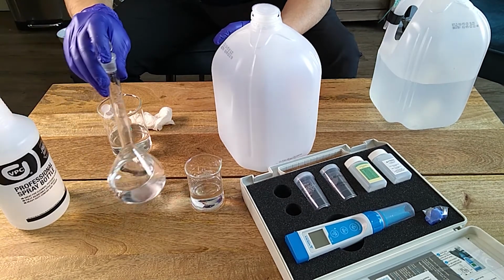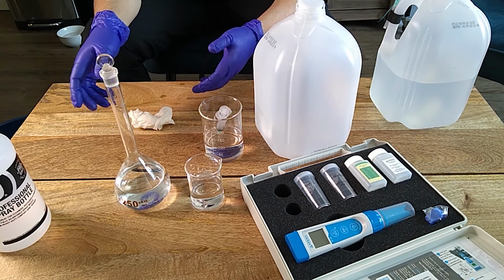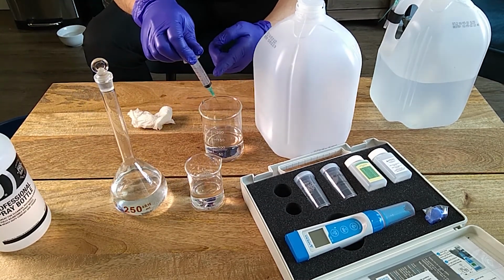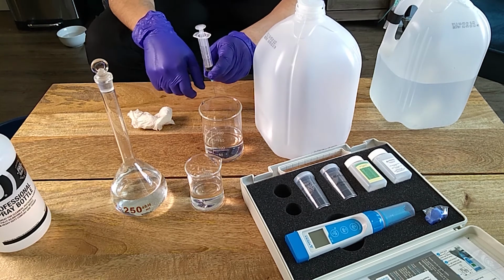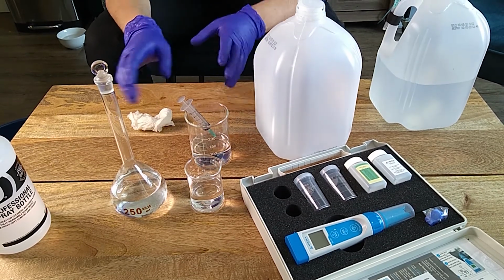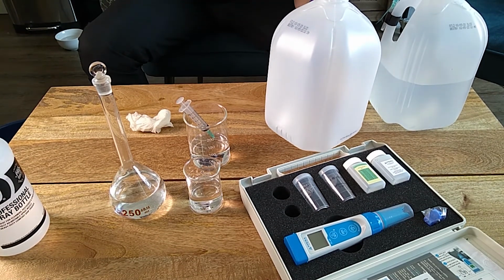So that's it. I hope that today you've learned how we can accurately measure dilution of any hydroponic product you want or any solution. You just need to know the application rate that you need. Then you prepare a solution that is very accurate using volumetric flasks and accurate measuring material, which can be either calibrated pipettes or calibrated syringes. These are pretty good because you know that people's lives depend on these things being accurate, so you know they're not gonna screw it up. And that's it. You determine this accurately, you measure the conductivity, and now you know exactly what the conductivity of any container should be, either something like this or something like a huge tank.